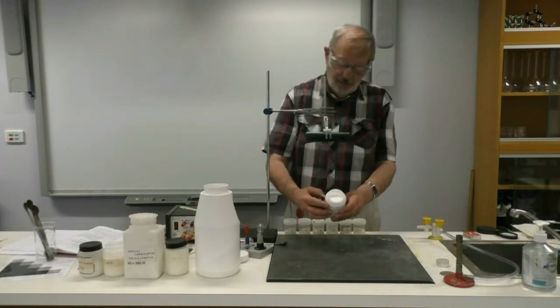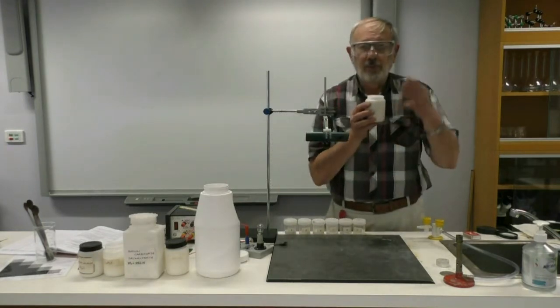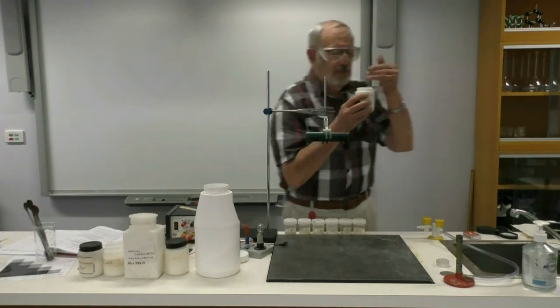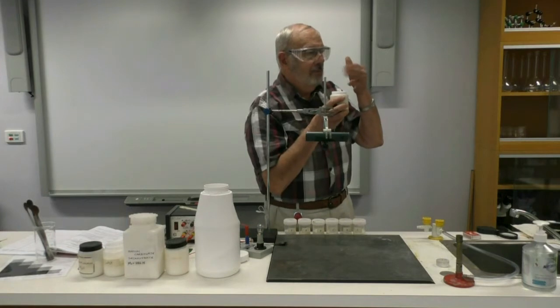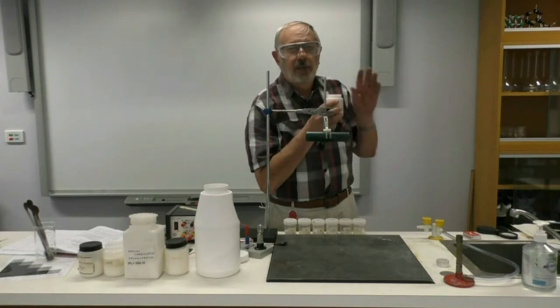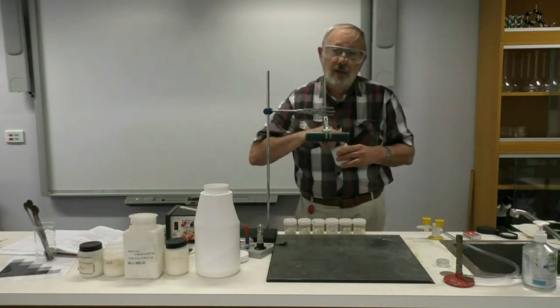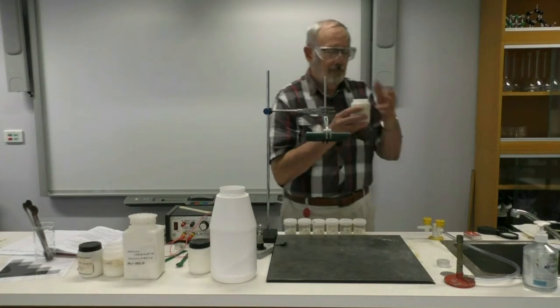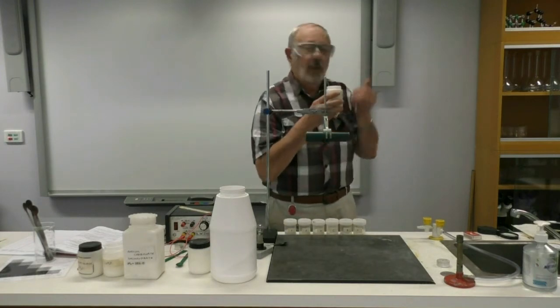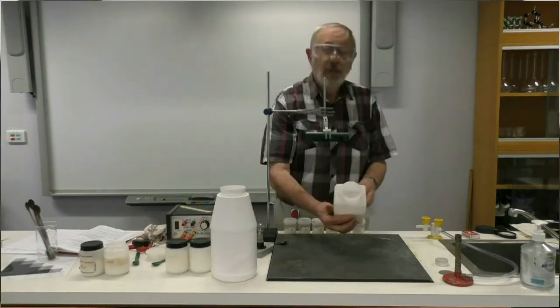Again, if I take the sodium chloride and hold that up towards my nose and waft some air towards my nose. No, I can't smell anything, so no odour. Another way we can describe that is odourless. Looking at the sugar, again, sugar is odourless, doesn't have a smell.